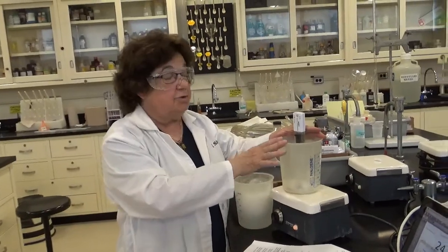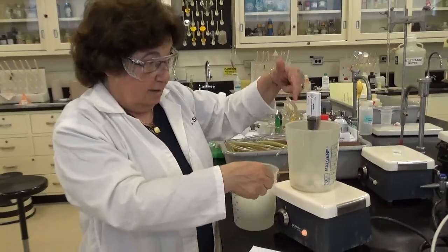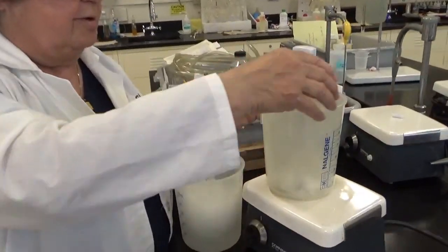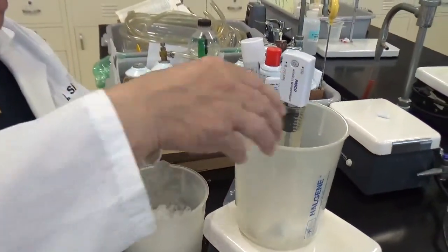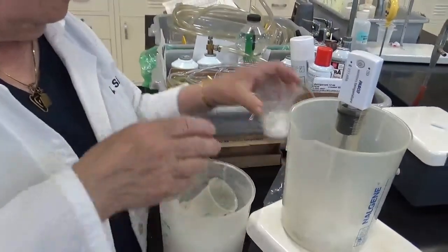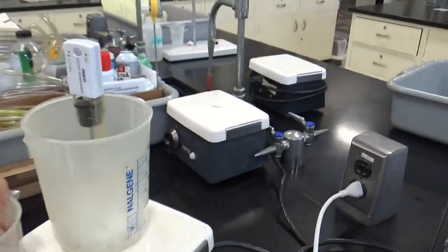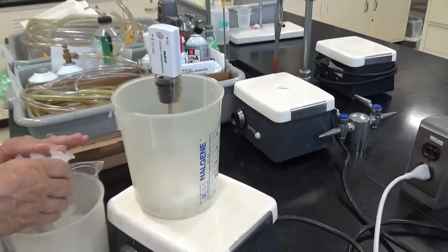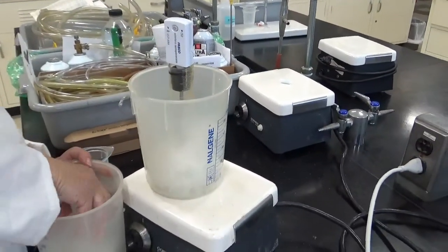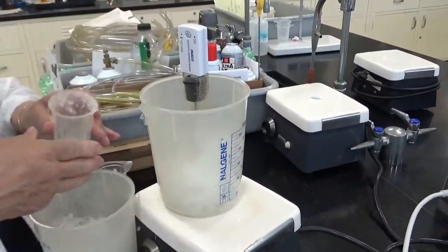Okay, so what I'm doing now is building an ice bath around the apparatus. And so I put the apparatus, our graduated cylinder, into a large beaker, and I am going to fill it with a little ice and a little salt and a little water as well. Now the water also comes from the melting part, so I don't want to add too much water. Wow, this is getting frozen in place.